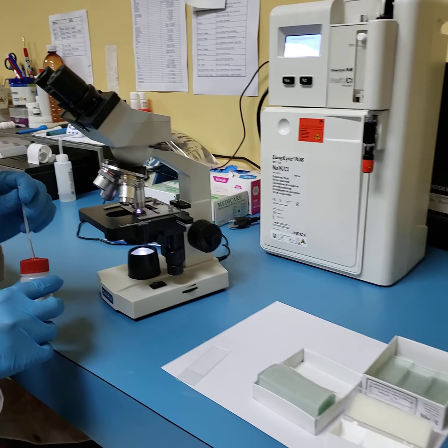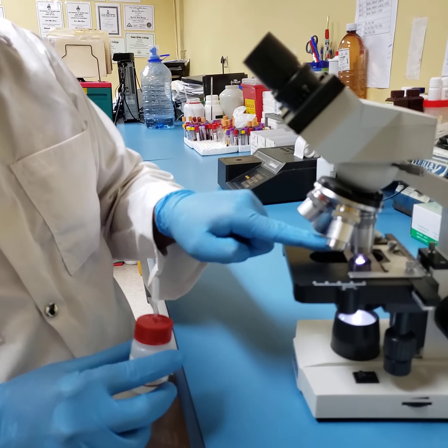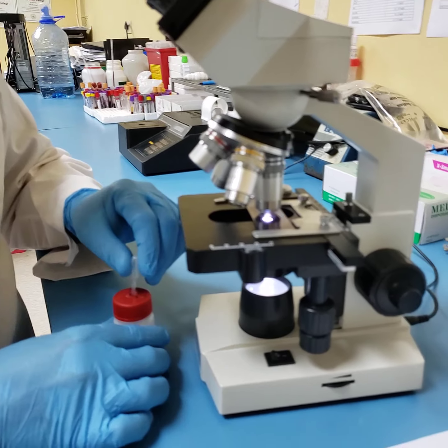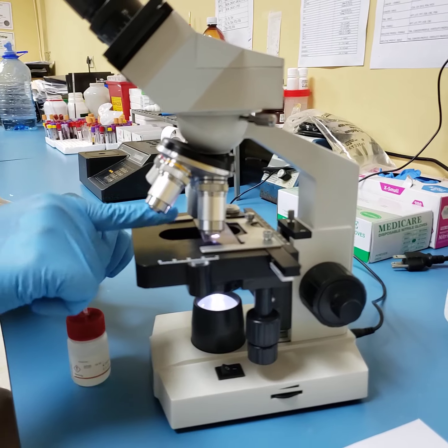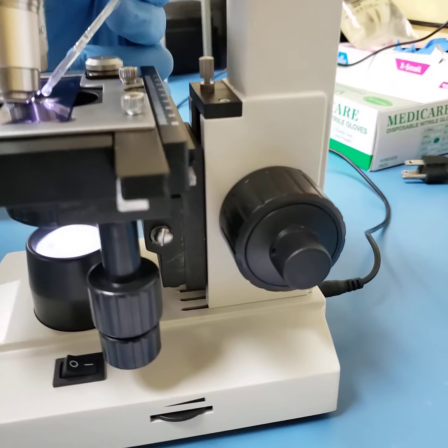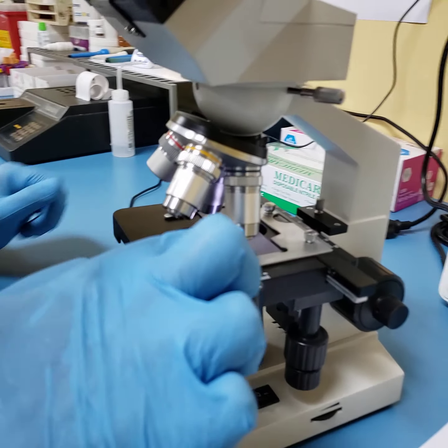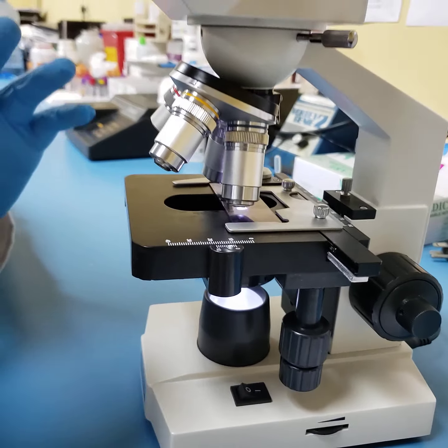Because these oil immersions come in dropper bottles, and you notice, as I mentioned before, how close the times 40 lens is to the slide. When you want to magnify more, you've got to firstly kick your 40 out of position. Then you go from the back, students, or you come from the front and you administer or add 1 drop of your immersion oil. Your times 40 lens, which is your high dry, is free from any contact of that oil.